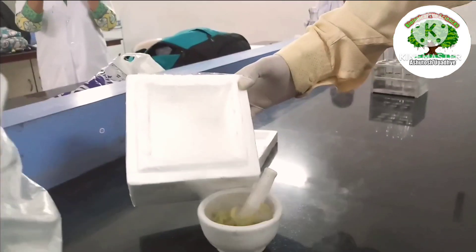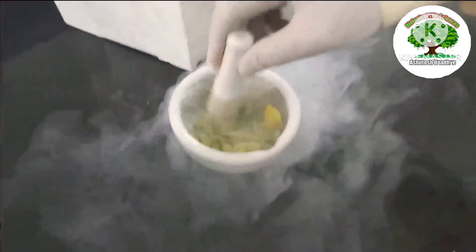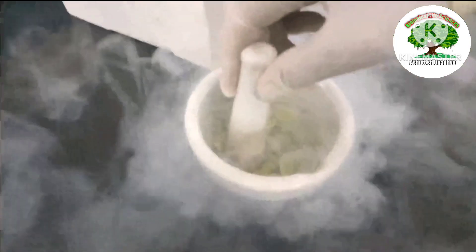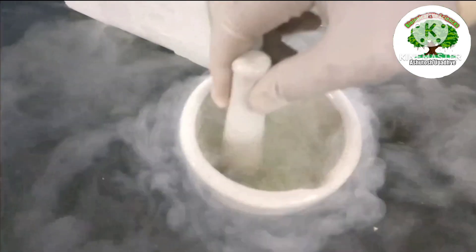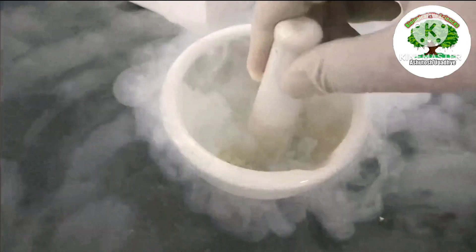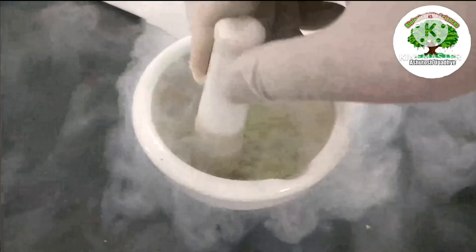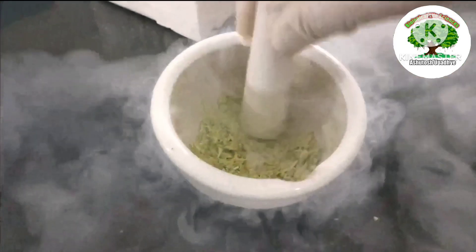After adding the liquid nitrogen, the water which is already present inside the cells of the leaves gets immediately crystallized due to the rapid lowering of temperature caused by liquid nitrogen. This forms sharp crystals inside the cells. Now when you crush this tissue, the sharp crystals bring about disruption of the cell structure.